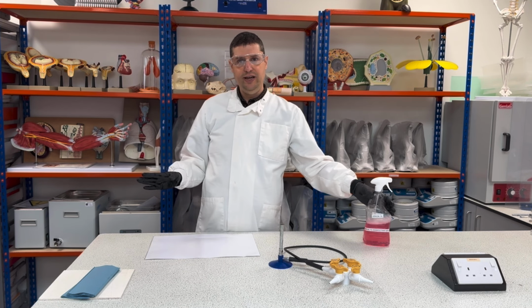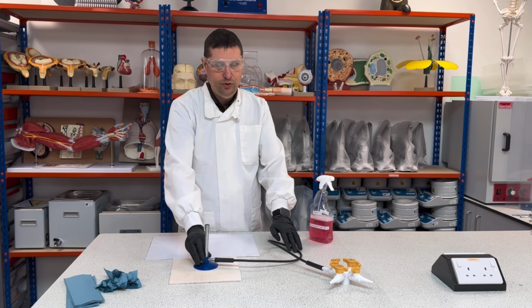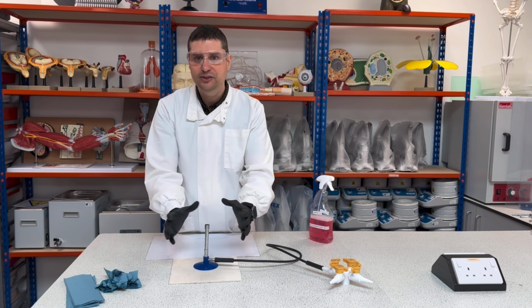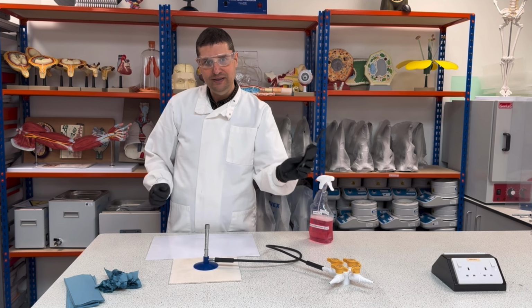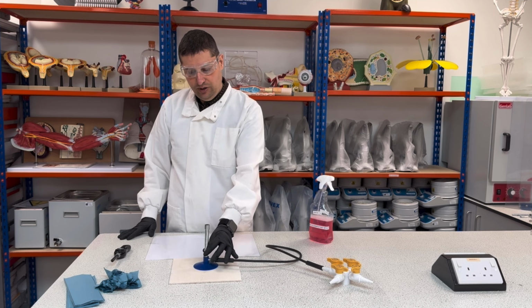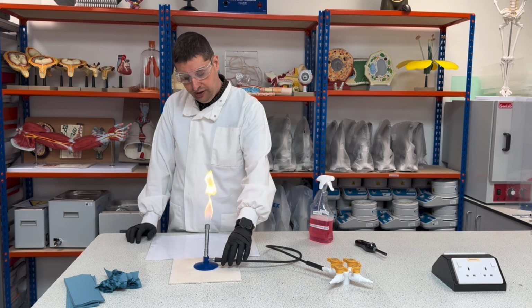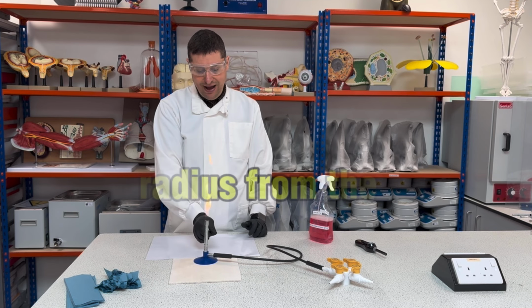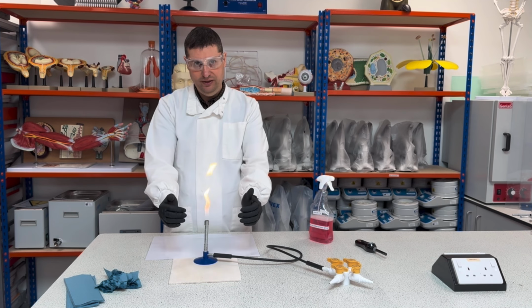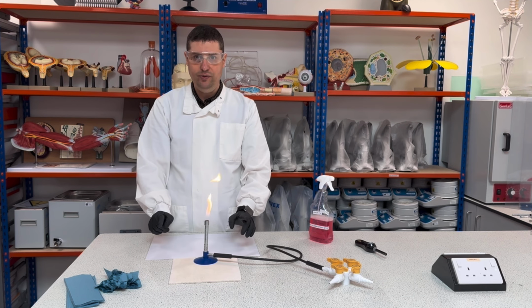Same procedure, okay? My Bunsen burner doesn't need to be disinfected, because the Bunsen burner will be, in terms of sterility, the most sterile part possible here. So I will light the Bunsen burner, and I will choose the yellow flame, okay? So the area where I should work is about 10 centimeters radius from the Bunsen burner flame, okay? So it's about this radius here. I call this area sterile.